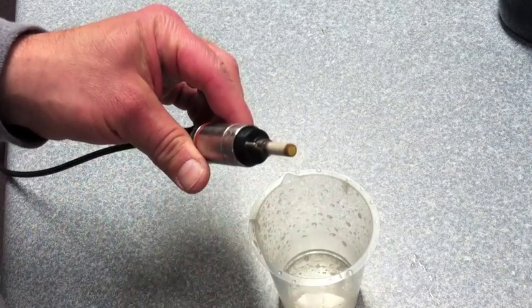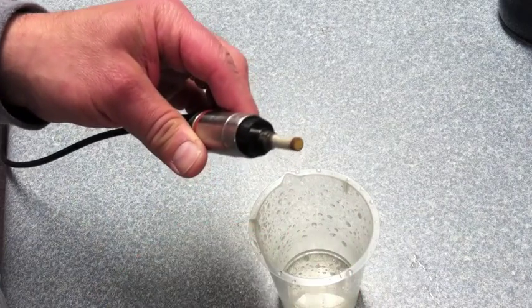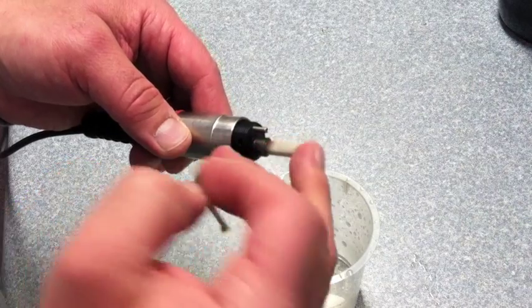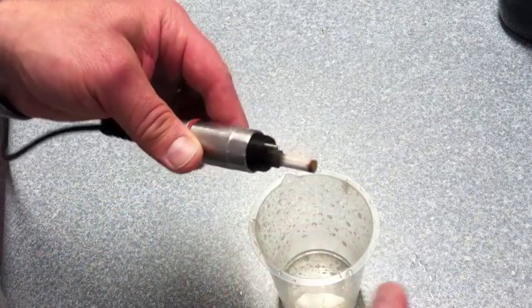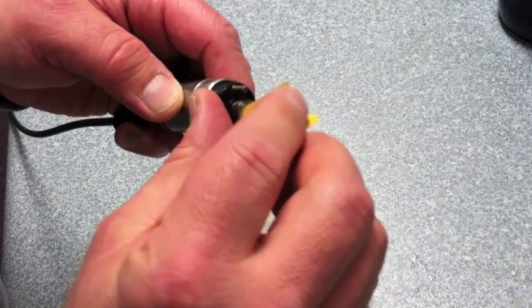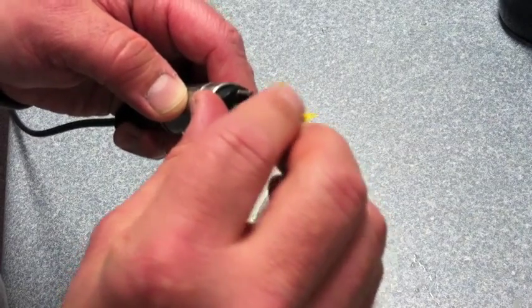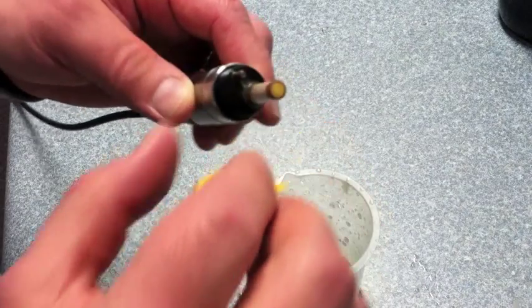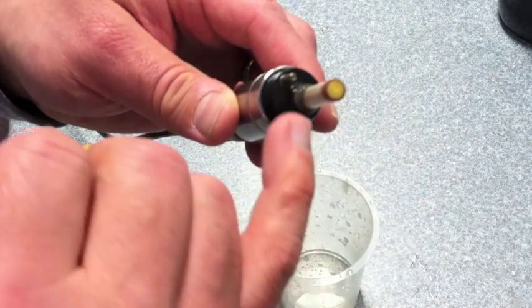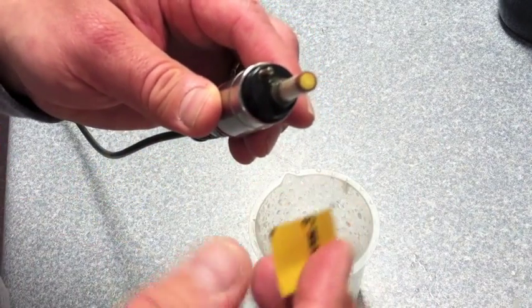Then getting back to the mechanical cleaning on the gold, you want to make sure that you clean off any of the residue, as the silver has transferred to the gold, and you want the gold to be a bright brass color with a matte finish. So just carefully look at your probe and make sure that there is no silver left on it.